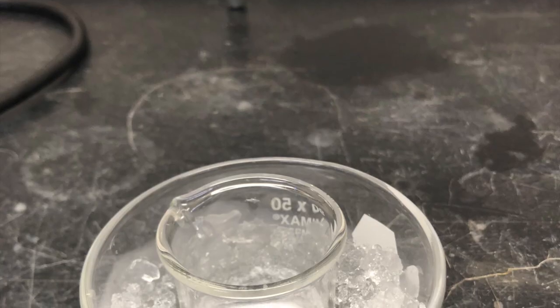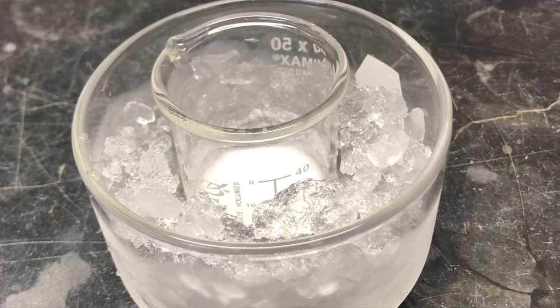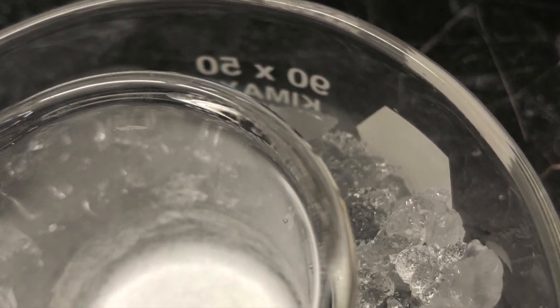In order to make sure that all of the solid has come out of solution, we place this mixture onto an ice bath for a few minutes. You can see the crystals are rather large and chunky.